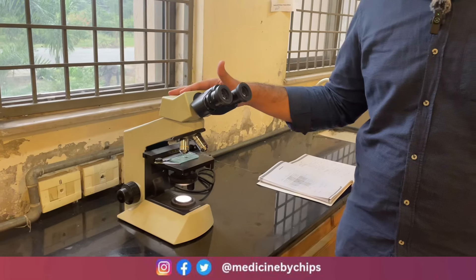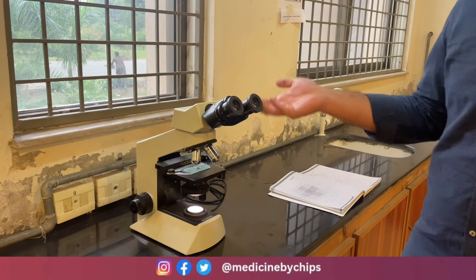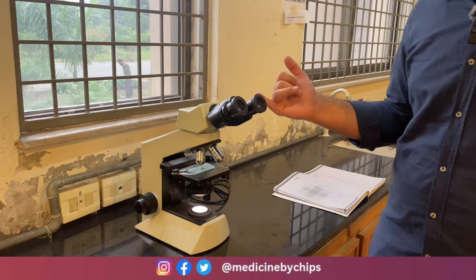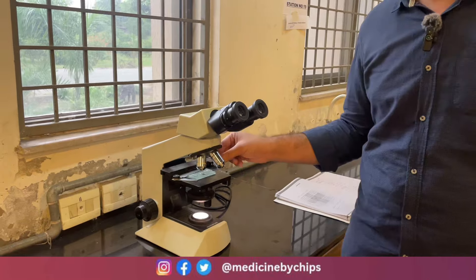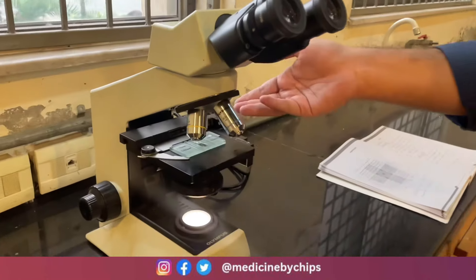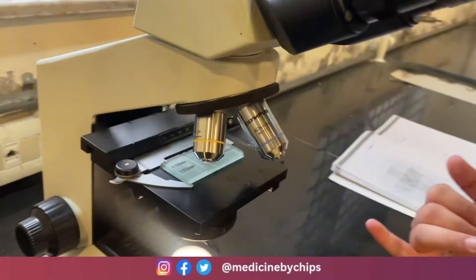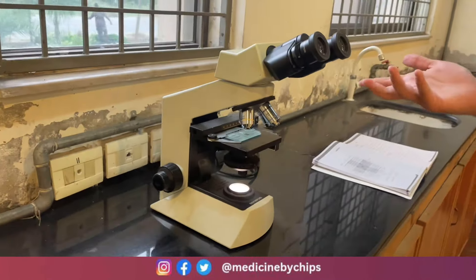First of all, let's talk about the microscope. The light microscope has various lenses that we use to view the image it produces. There is an eyepiece lens which is basically 10x and an objective lens which is also 10x for this particular experiment. We can also have the options of 4x and 100x, with 100x being the oil immersion one.